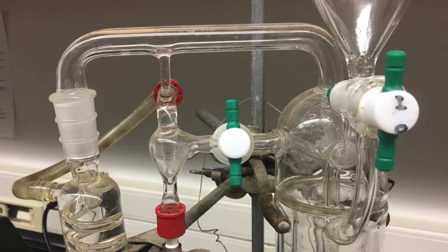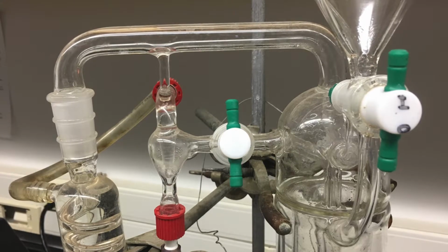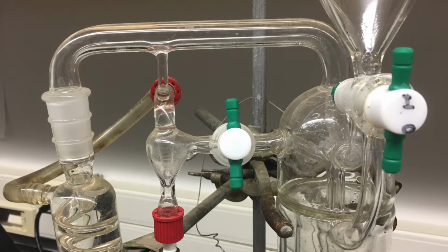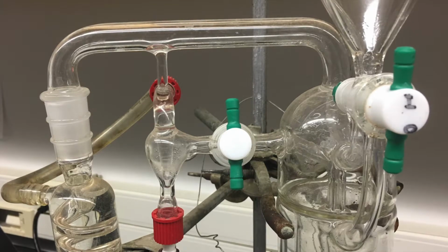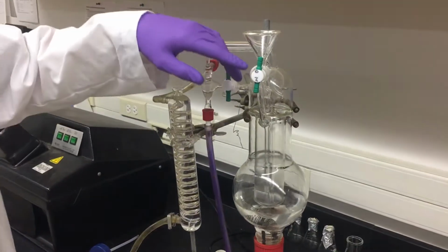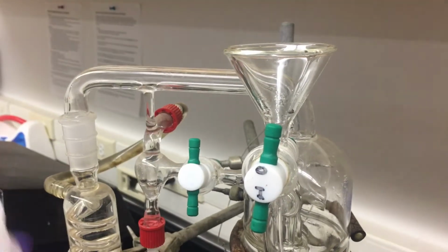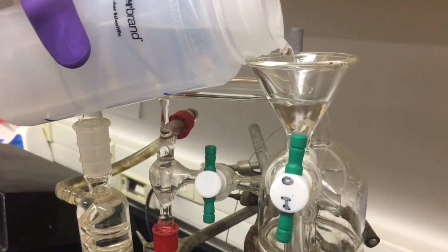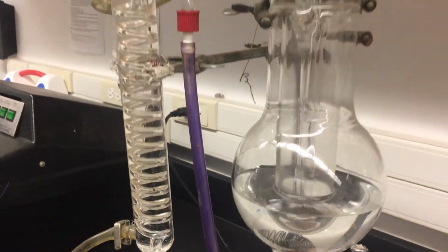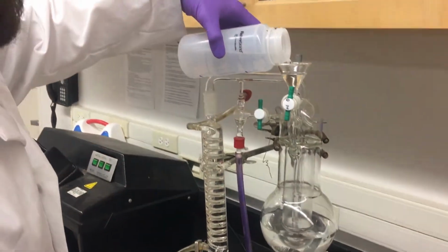The center stopcock is known as the sample chamber evacuation stopcock. When perpendicular, the stopcock is closed. When parallel to the joint, the sample will be flushed from the sample chamber into the water lines and into the sink. Making sure that the stopcock indicates the outer chamber, use the top funnel to add distilled water to the boil chamber, covering the bottom of the sample chamber by at least 2 inches.